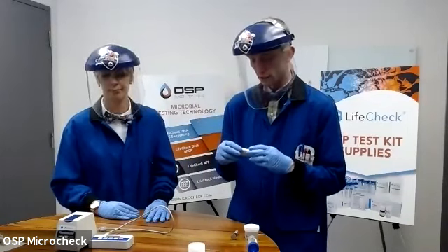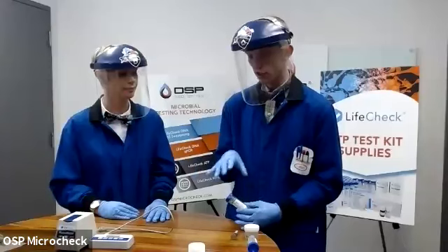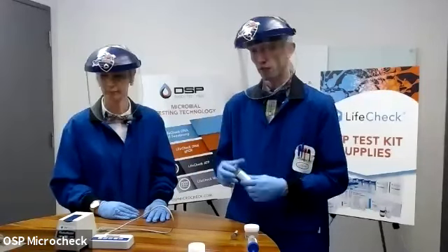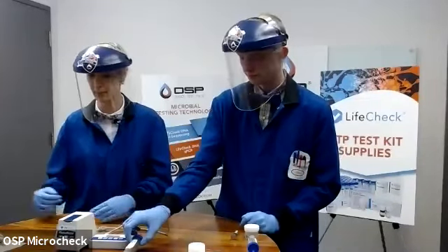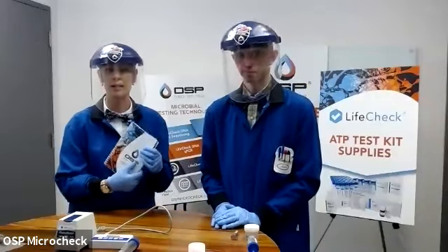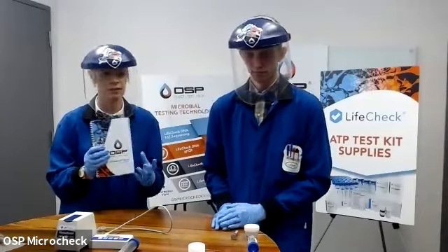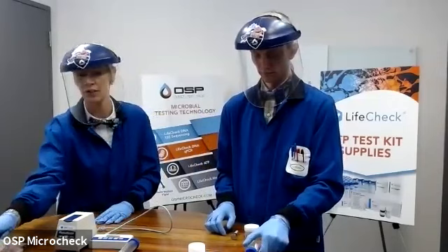There's also a separate tab on the calculator spreadsheet for this test. So just make sure that you're treating all of your batch of samples in the same manner. And as we get into the next step as well, just know that all of the calculations that we use are fully available in the handbook, whether you use it digitally or have your own version.